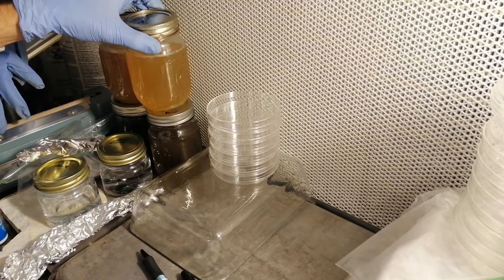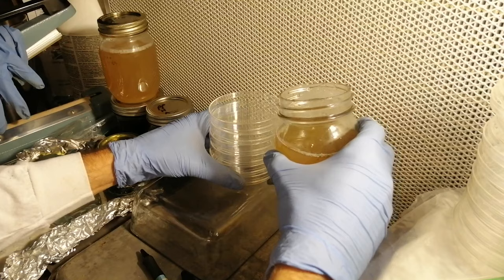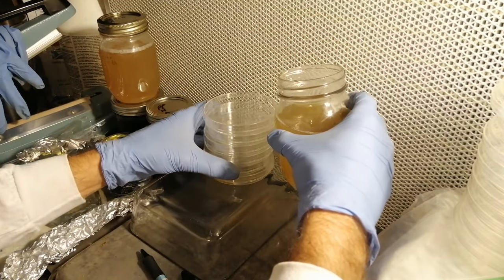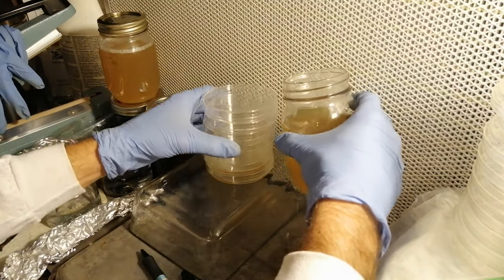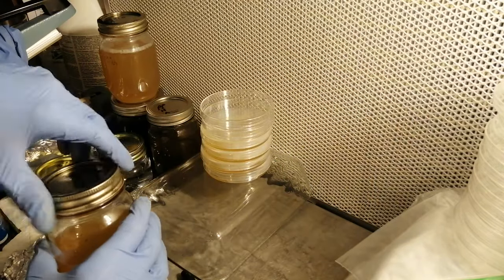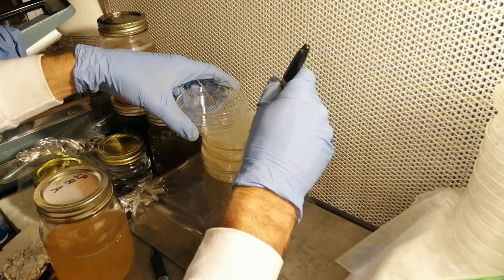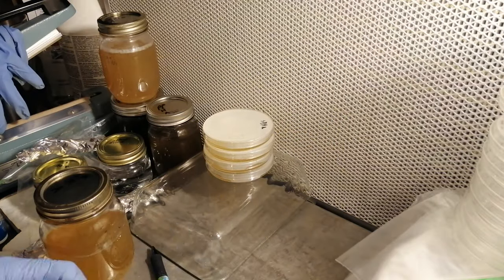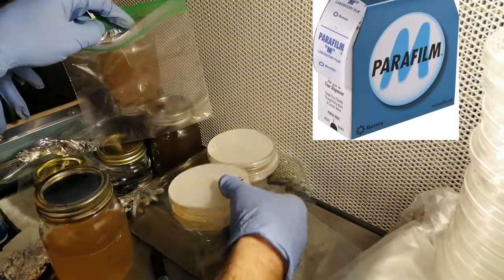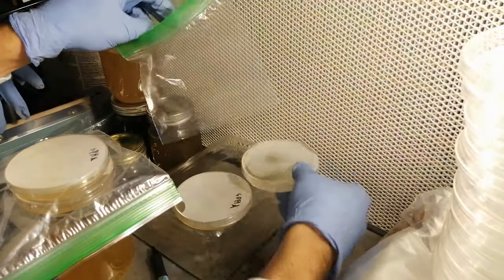I'll create a few dishes from each type of agar, starting with the sweet potato honey agar. You can start with the bottom plate first and work your way up to avoid having to lift dishes with agar in them already. You want to pour quickly and only need enough to cover the bottom of the dish — don't fill them up all the way. If there's a little spot that didn't get agar, you can just swirl the plates later and it'll completely cover the bottom. I'll label some of the dishes so we can remember which type of agar is in it, and then store them two dishes at a time in ziploc storage bags. Ziploc bags work well, come sterile, and allow for some air exchange which is required for the cultures.